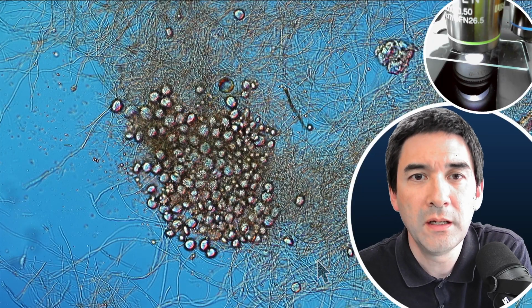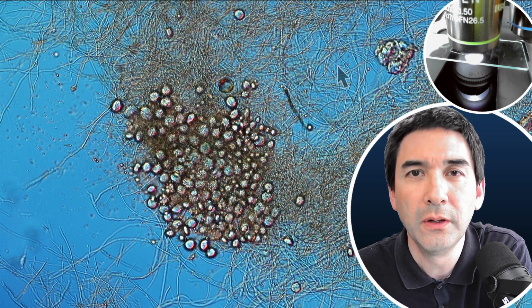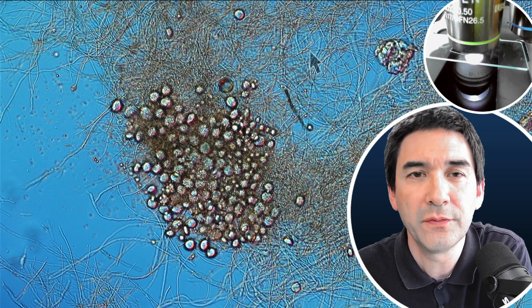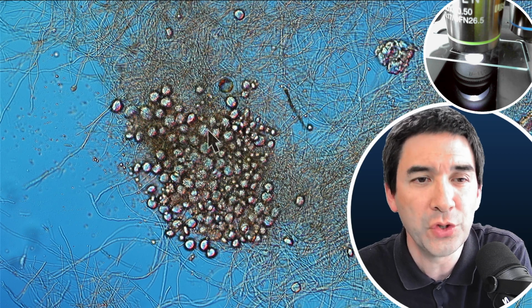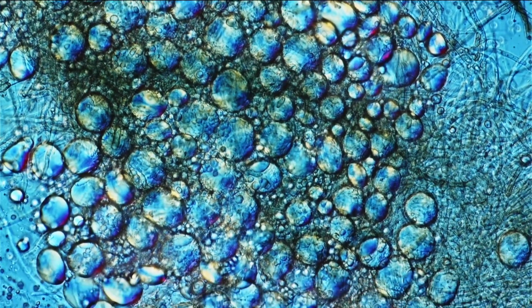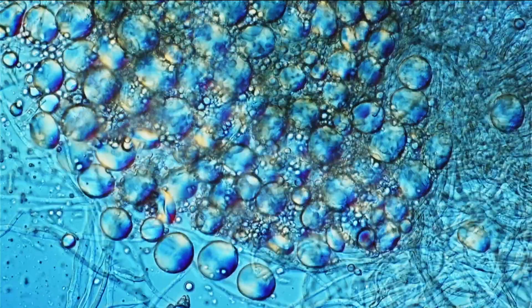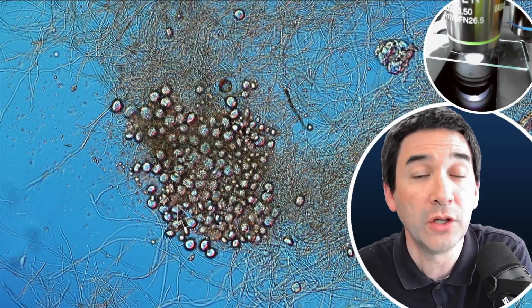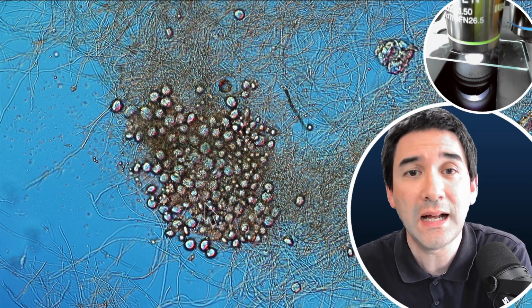Yeah, and this is basically how it looks like. Of course, here the fine network of the fungus, the hyphae, the cells of the fungus, and look at those round structures here. Now, when I first saw it, I said, "Well, wow, these are spores." But actually, I have to tell you, I have some doubts about that because they do kind of look a little bit irregular in shape. Normally, when I see spores, they're quite regular in shape. So I don't know really what this could be exactly.